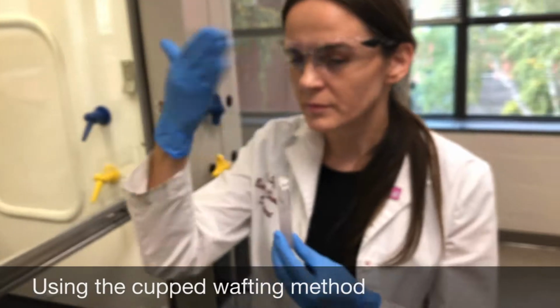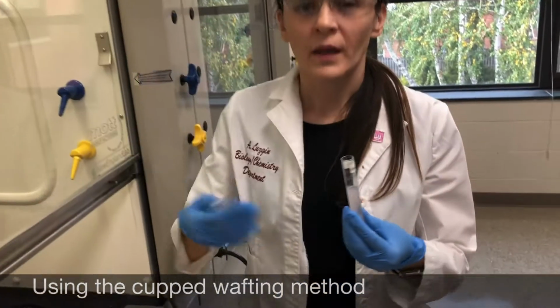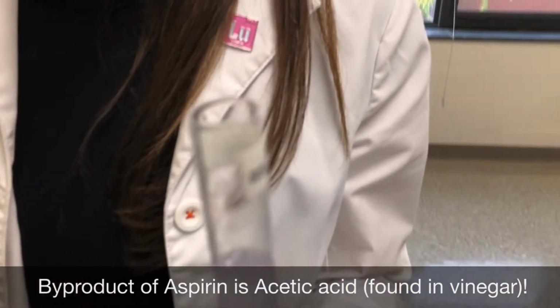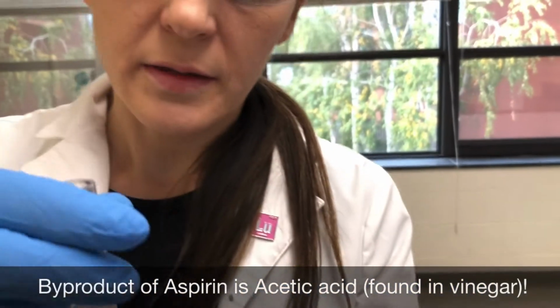Using the wafting method, what I'm smelling is a very strong odor of basically vinegar. So that is the acetic acid.